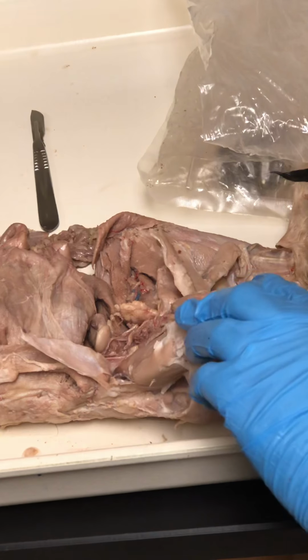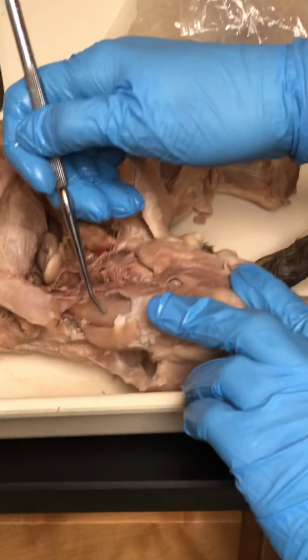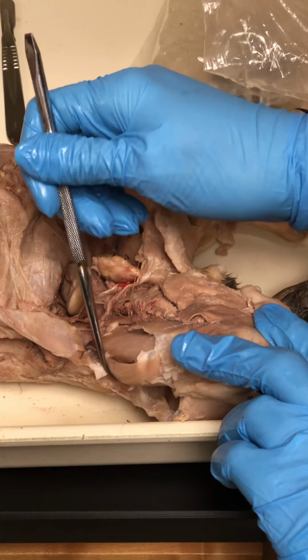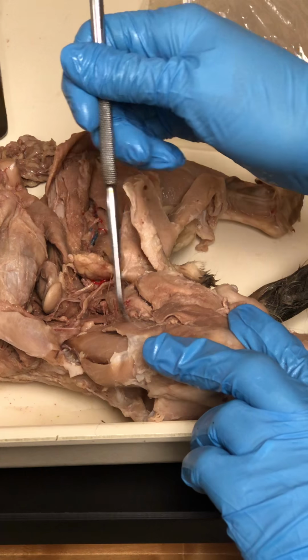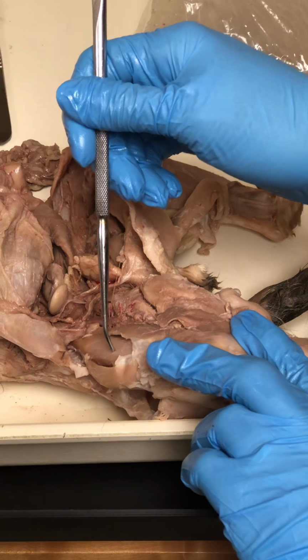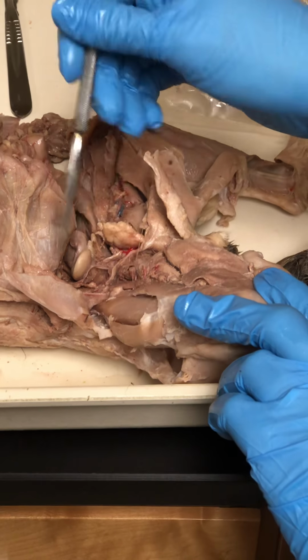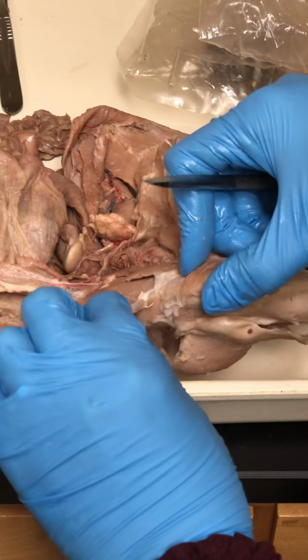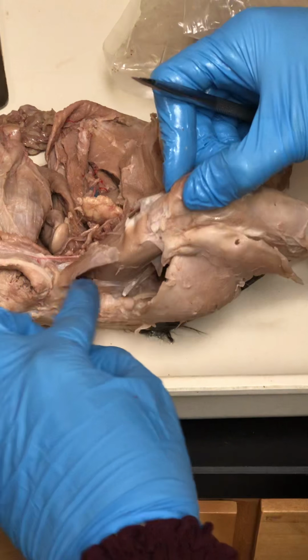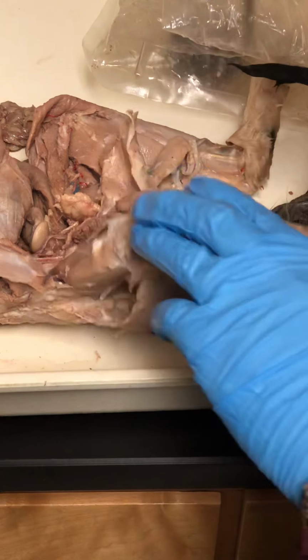Vastus lateralis. Okay. These are three of the quads that we can see. So we're now on the anterior compartment. So we've got vastus lateralis, it's on the lateral side, vastus medialis on the medial side, and then rectus femoris is the one in the middle. So we can see 3 of the 4 quadriceps like this. And the tensor fascia that we were just looking at sits kind of on top of that vastus lateralis, because that IT band, remember, comes down the lateral side of the thigh.